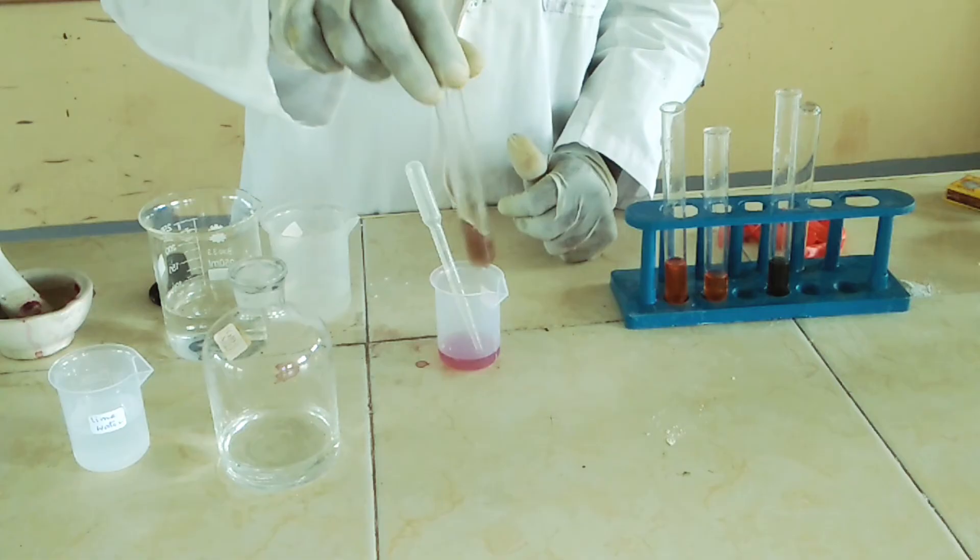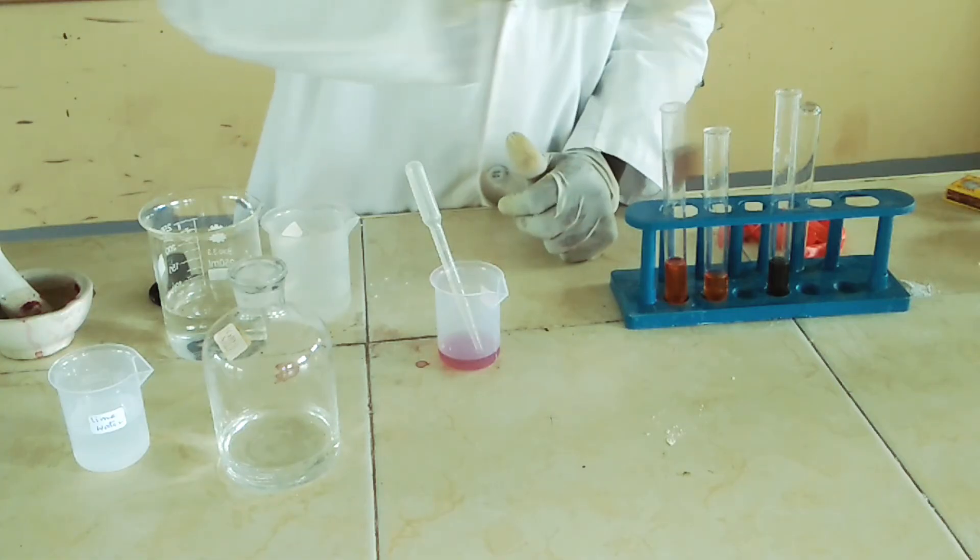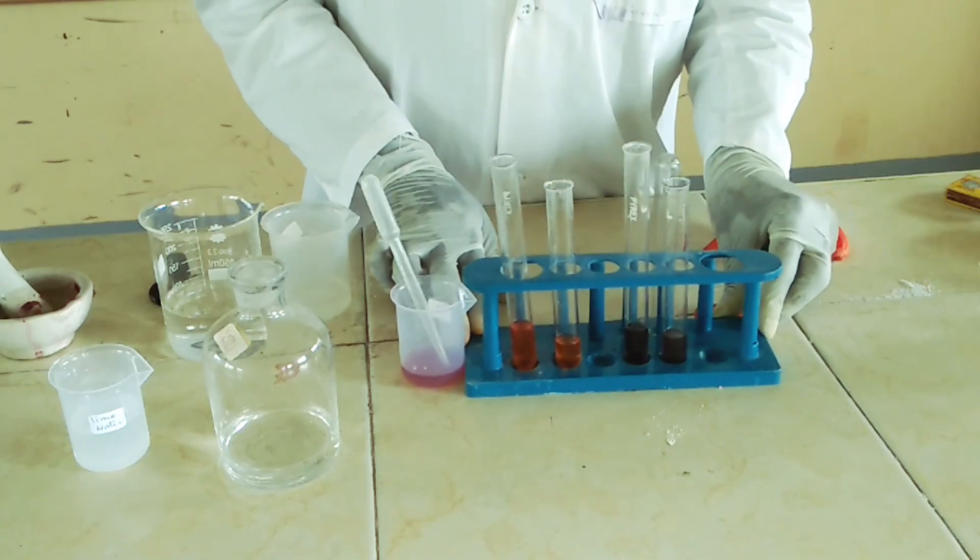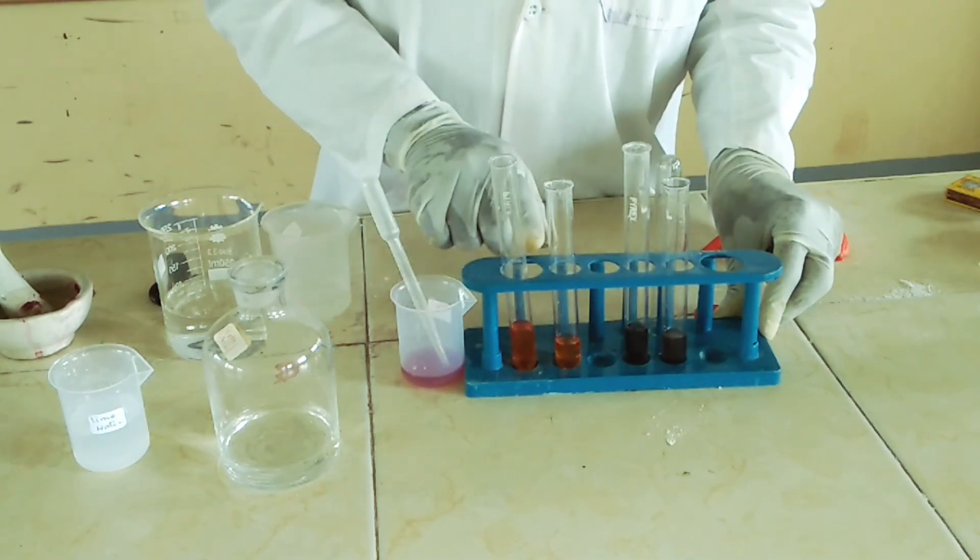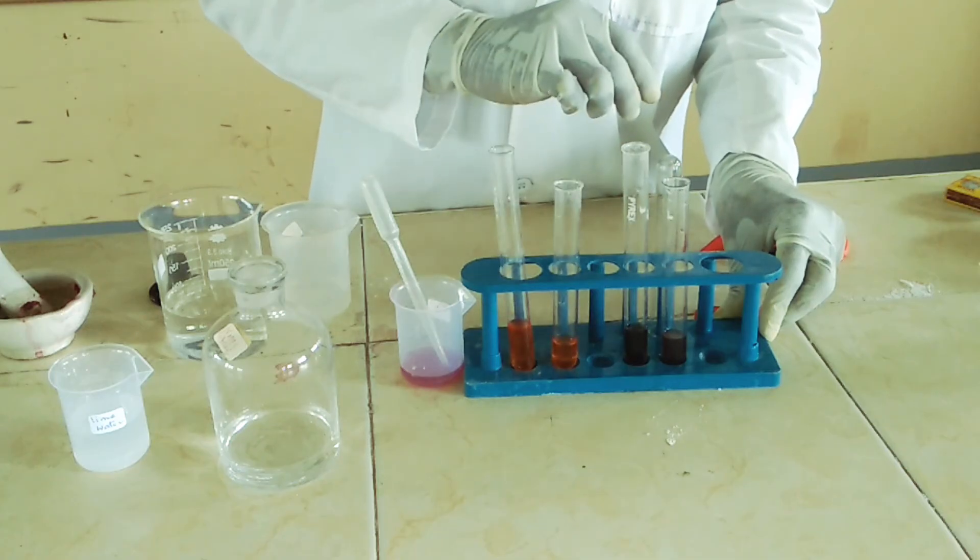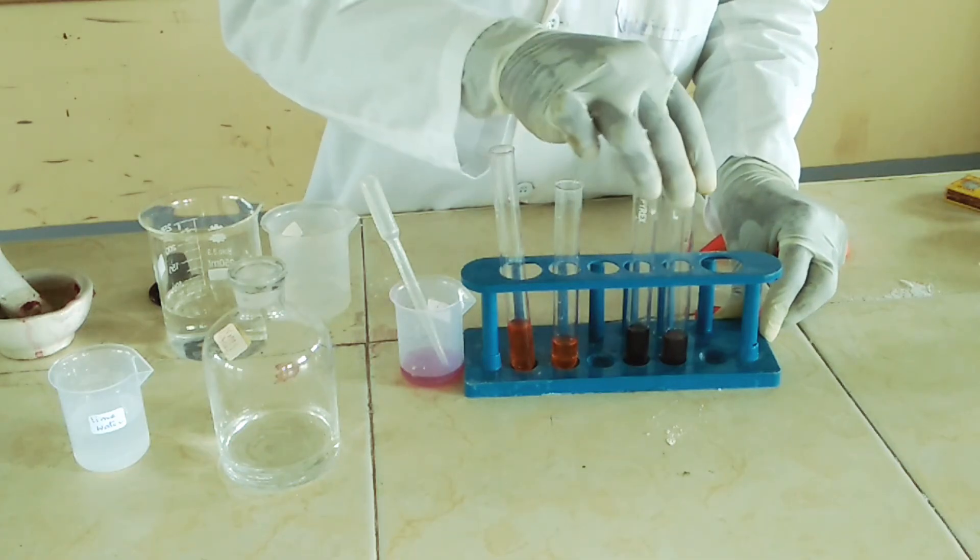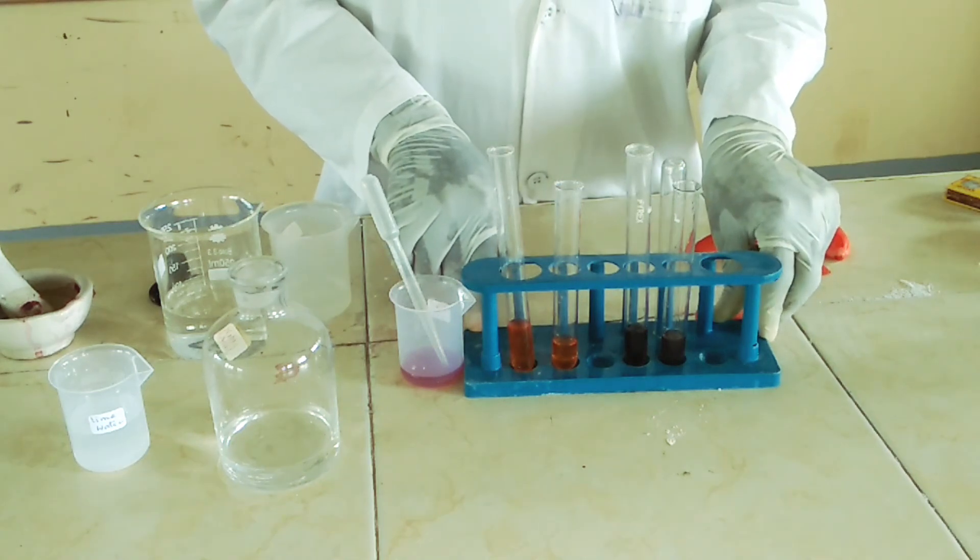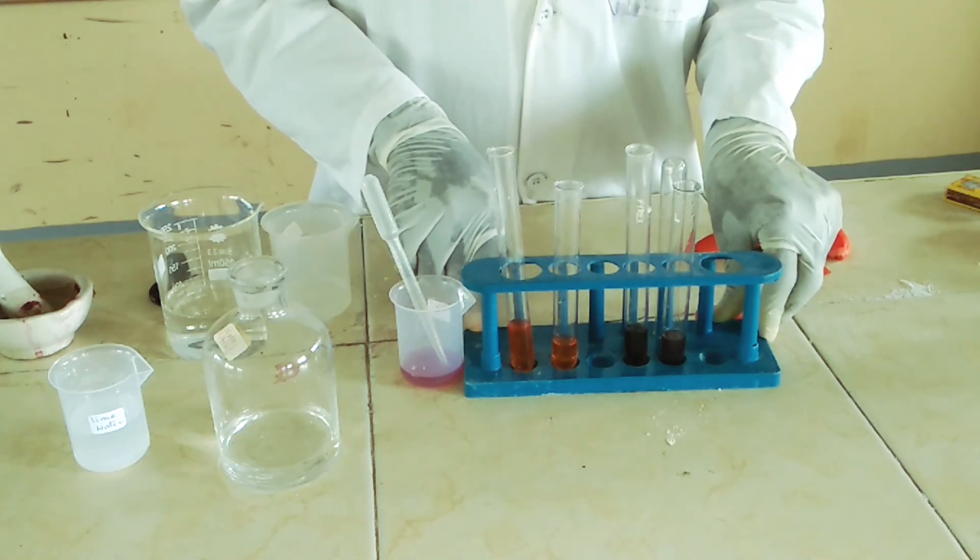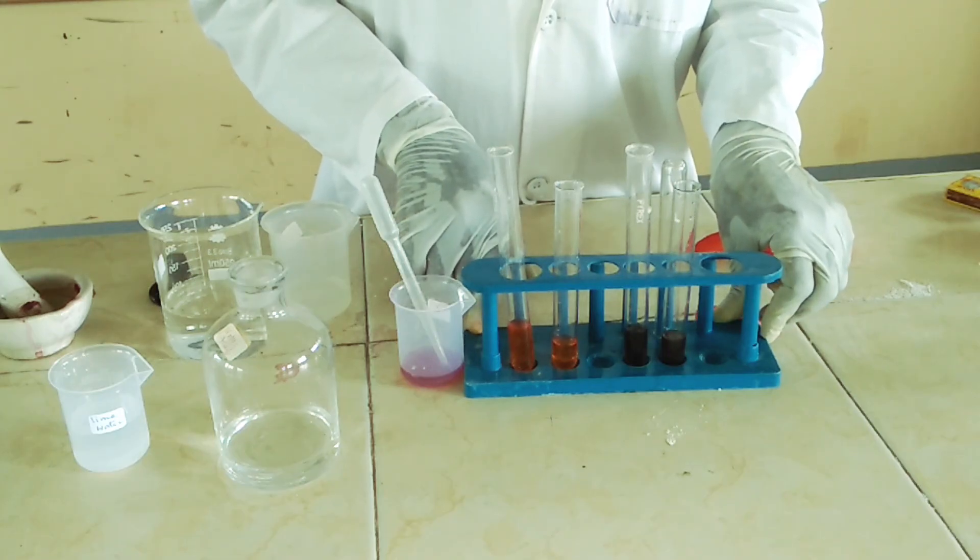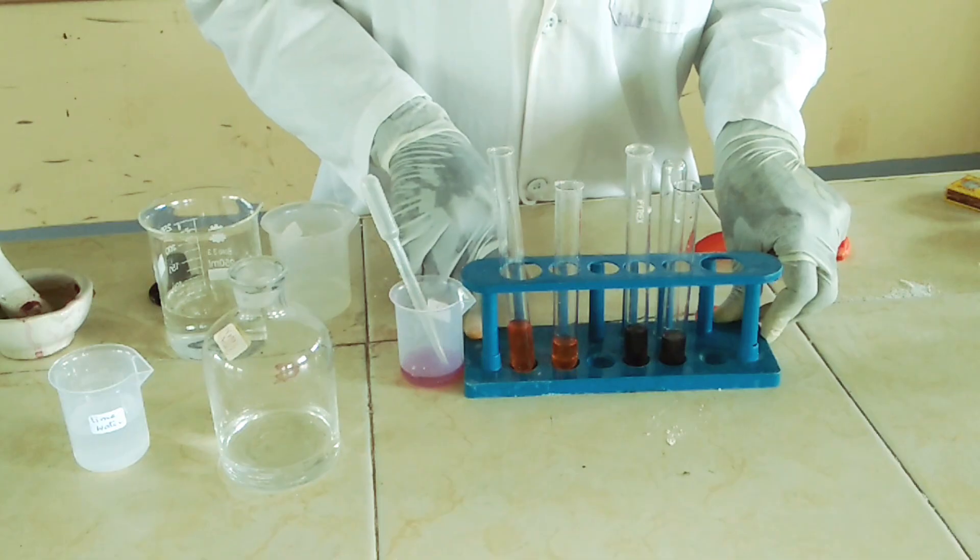Then test also lime water and shake. Again, we are getting the acids give the same color. And the bases are also giving us the same color, that is almost green. The only disadvantage of this indicator is that it's not consistent. The results change after some time, also depending on the solution. That is the only disadvantage of using this indicator.